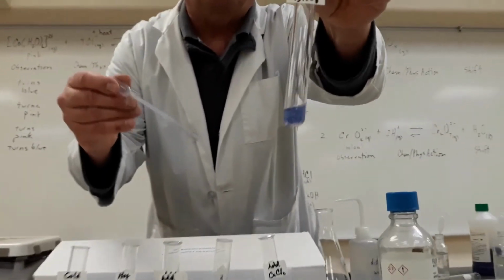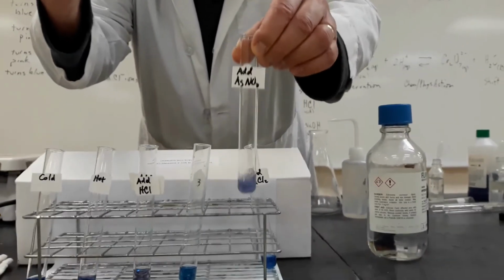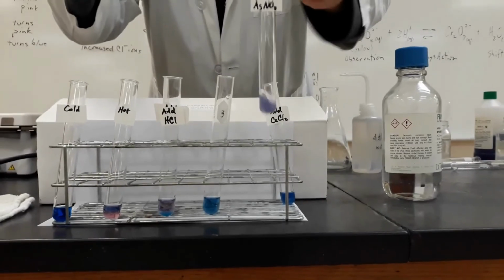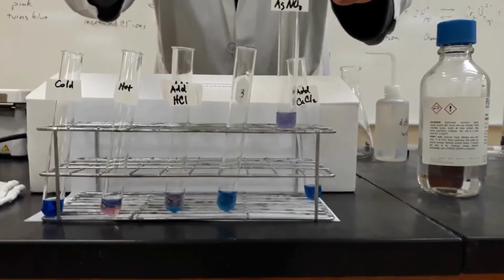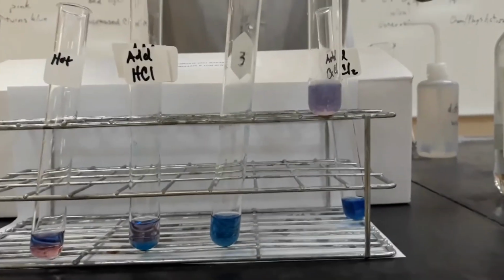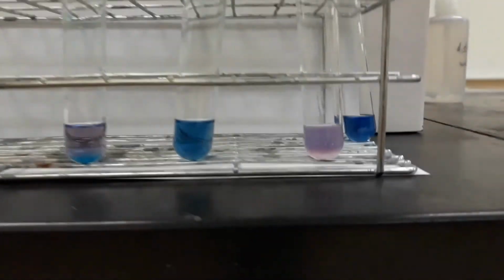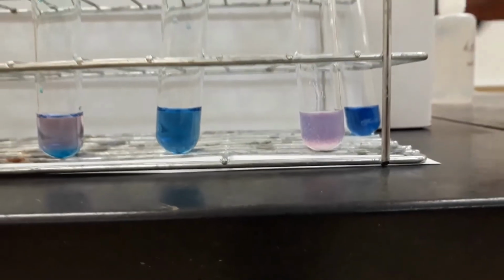See the white precipitate? And then what color is the solution turning? So the formation of the precipitate is the silver ion combining with the chloride ion. If you think back to our solution unit, silver chloride is insoluble.